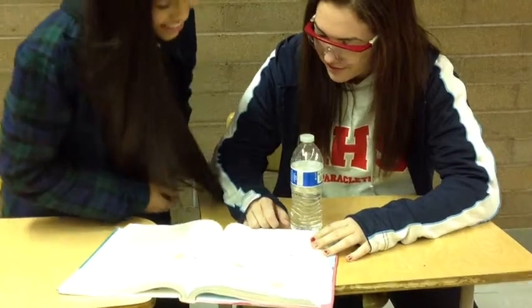Many precautionary measures should be taken. One being to make sure your hair is tied back so it does not get caught like Megan's. Luckily for Megan, Jenny has a hair tie. Good job, Megan.